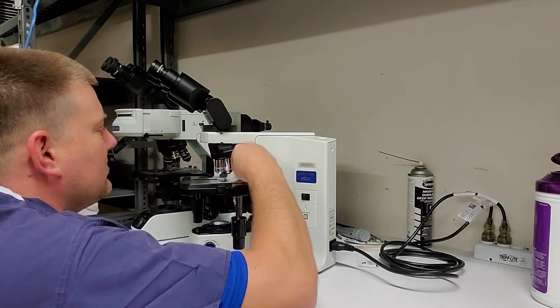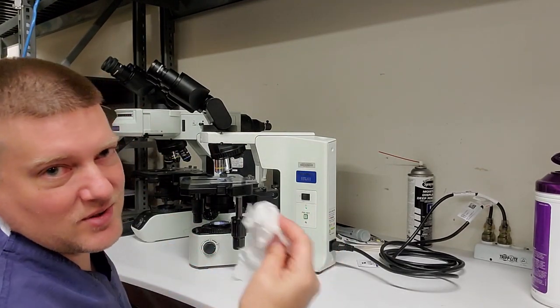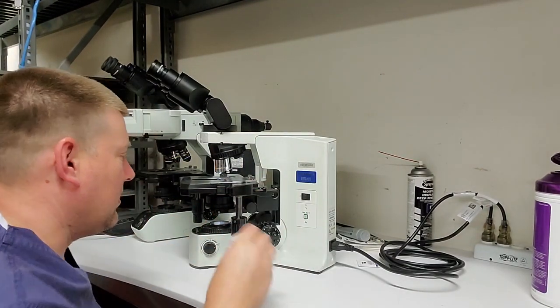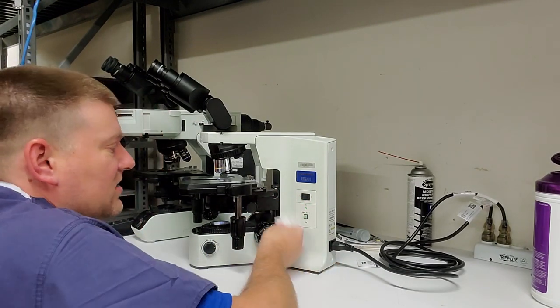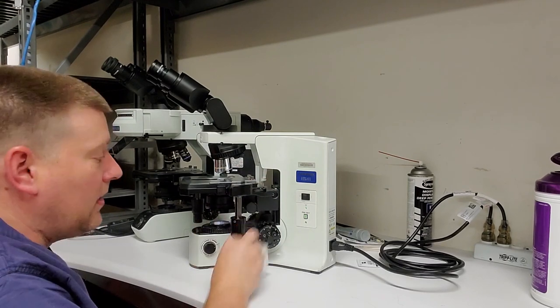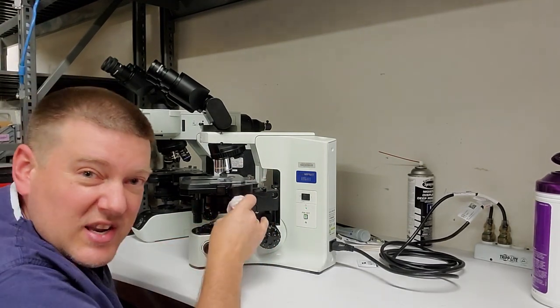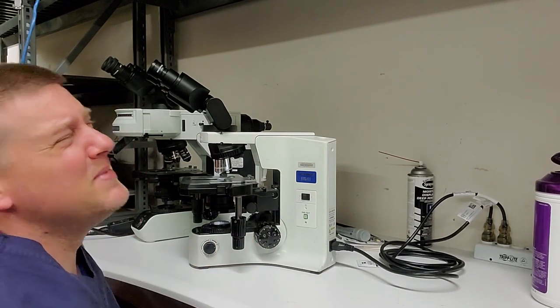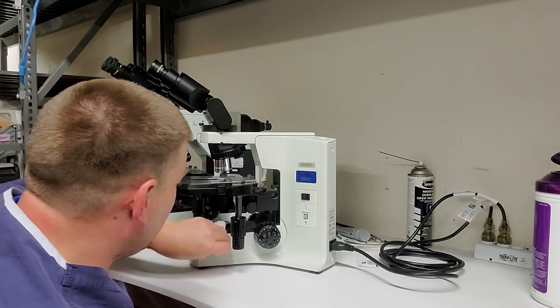contamination off of it. Notice my rag is a Sani wipe. I'm not cleaning the optics with a Sani wipe. You guys, I know what you're thinking. I'm not doing it. I'm getting around all the surfaces, the areas that I'm going to be touching with my gloves, because I do not want oils, contaminations like grease, something like that. Grease would be miserable to get off the glass, okay? So we want to clean all these areas.